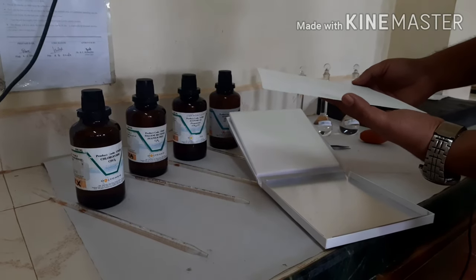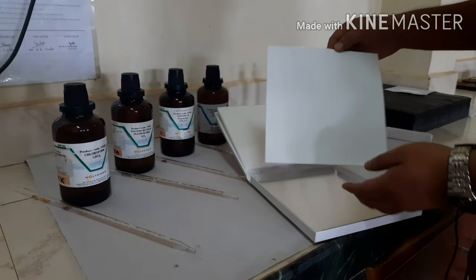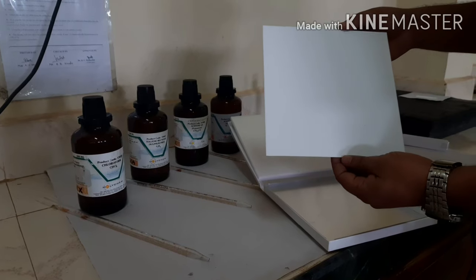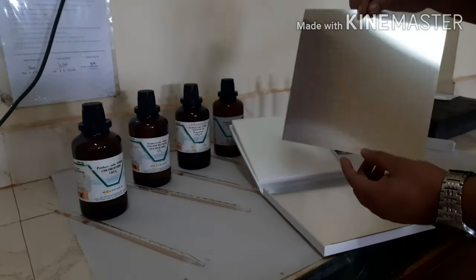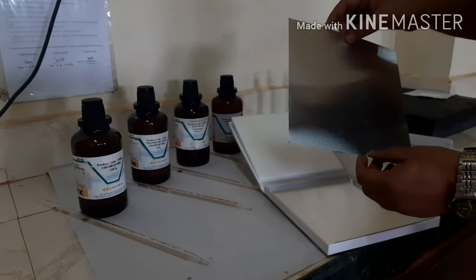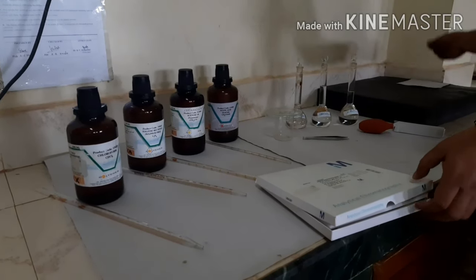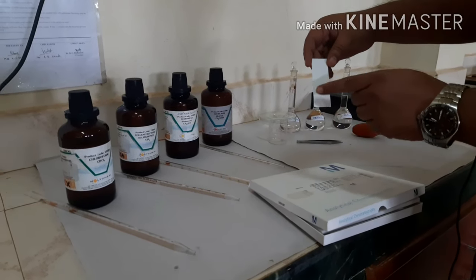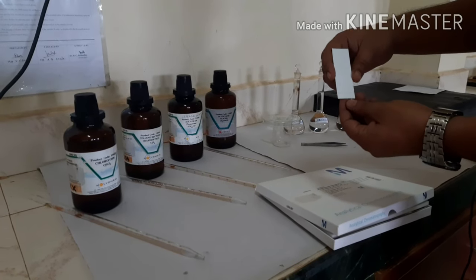The thinner the adsorbent layer, the faster the separation on the chromatographic plate. Since we don't need the full 20×20 cm size to identify one or two components, we can customize these plates by cutting with a knife or scissors as per our requirement. We can cut the plates to a size suitable for spotting three samples or standard substances.